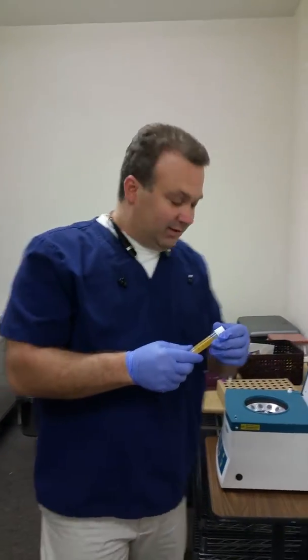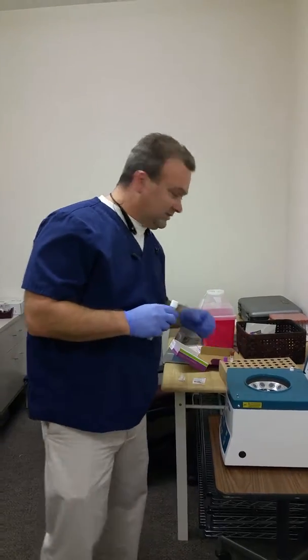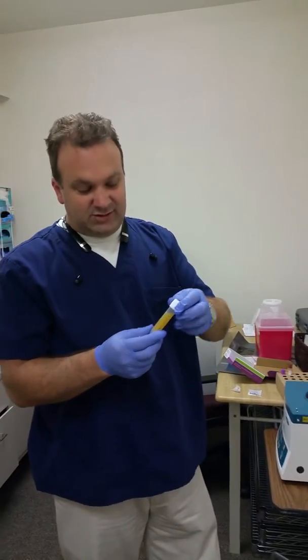Hey, how's it going? I was just doing some processing for the Murray and Valley Laboratory. It has this little kit right here — it's SST tubes, and you just take the SST tubes and you pour them straight into these little vials.